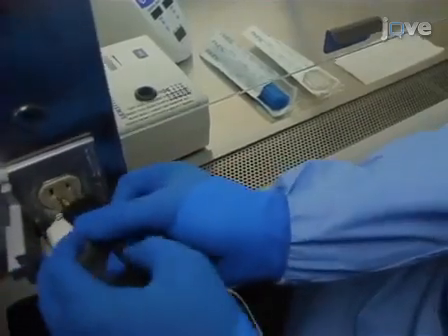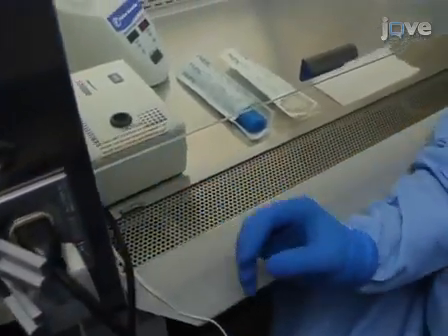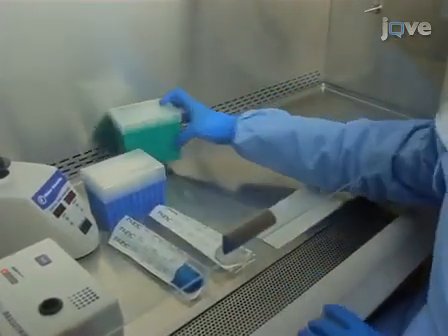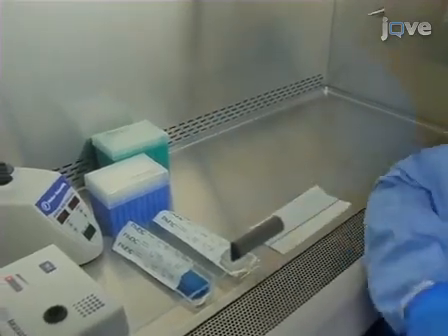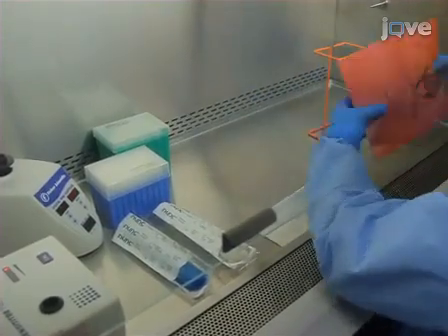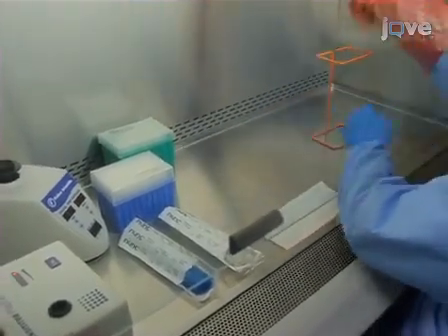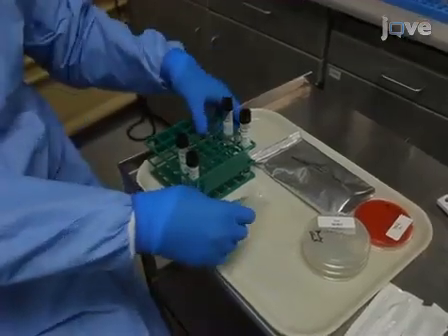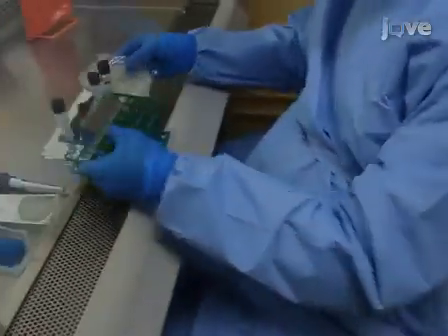Next to the paper towel, place inoculating loops, pipetters and tips, an appropriate waste disposal container, a nephelometer, and a vortexer. Once the hood is prepared, place the organism on the paper towel, along with a rack with a McFarland 0.5 standard, a 7H9 broth with OADC, and a saline bead tube. This setup is done from solid medium.